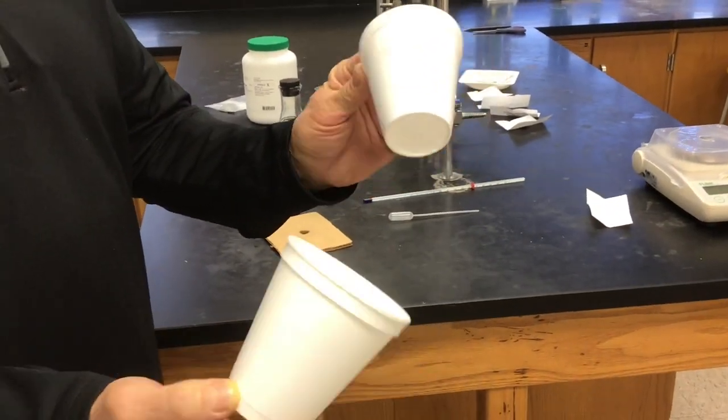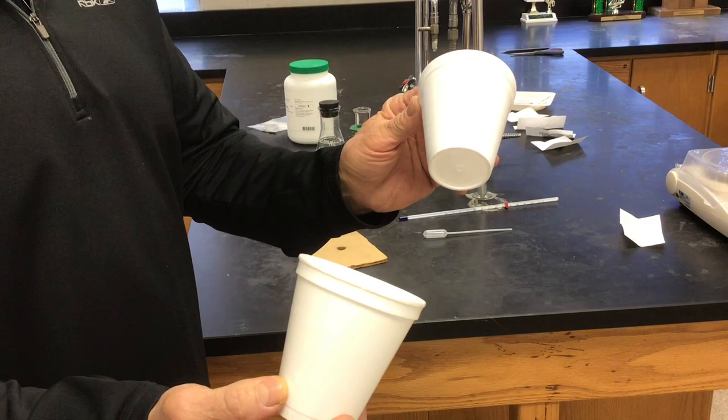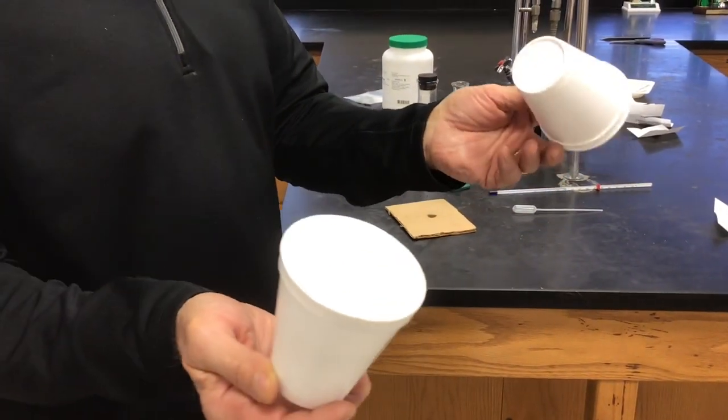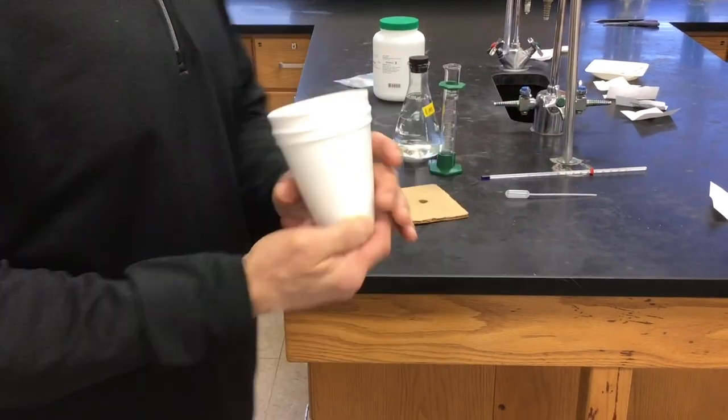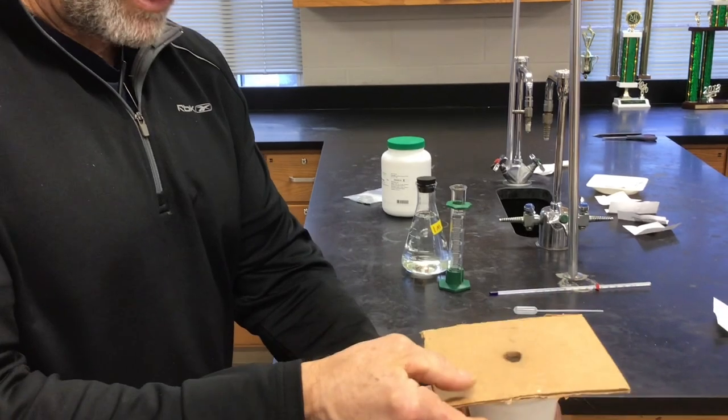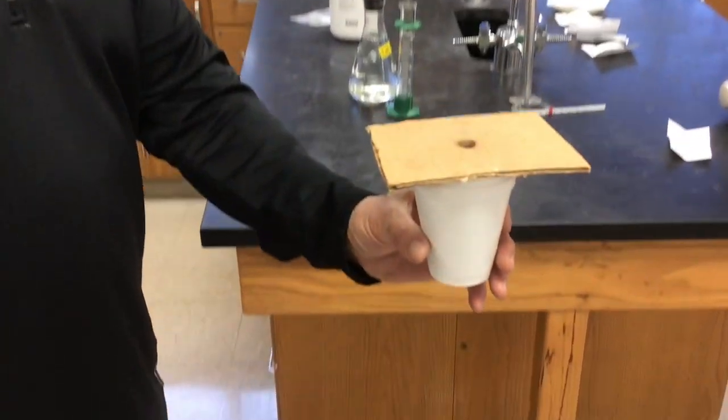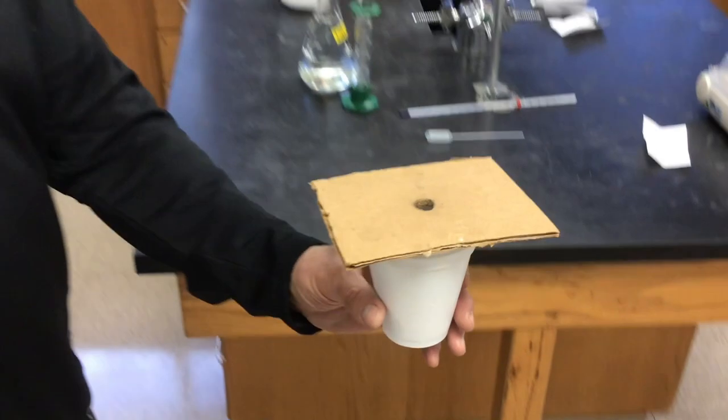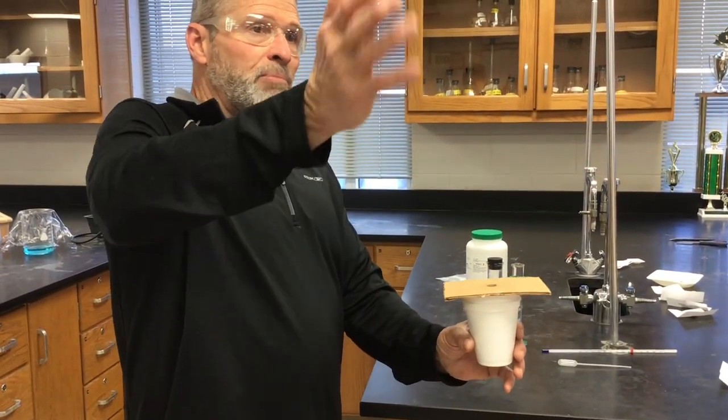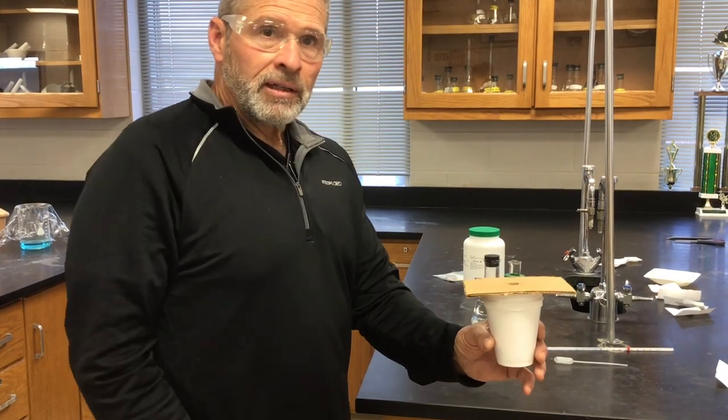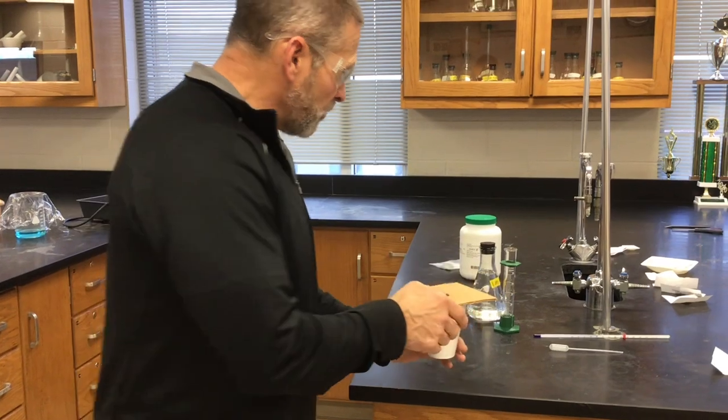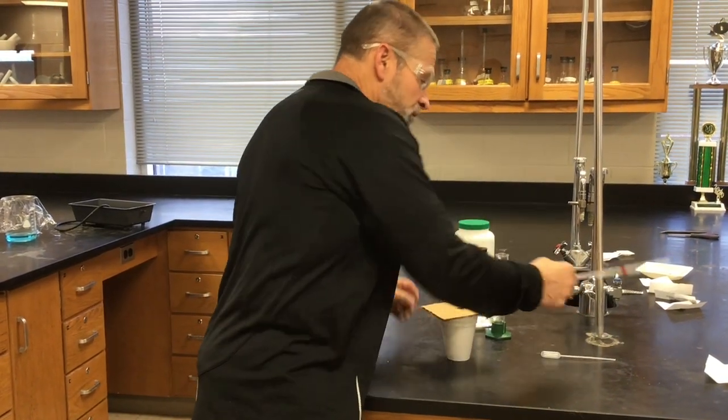And Troy, we always use the best possible equipment for you guys. That looks like fabulous lab equipment, Mr. Hevel. And we're not using just one cup, of course. We're nesting them together for two. We have this tremendously precision-made lid that fits over the top. And remember, coffee cup calorimetry is all about looking at what happens in the cup. We're trying to prevent heat flow from the surroundings influencing what's in the cup. So that's what this is for.